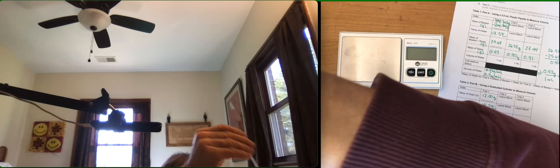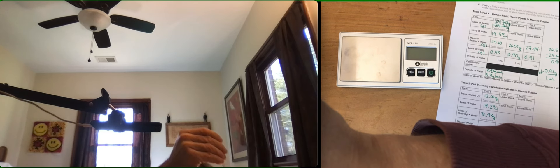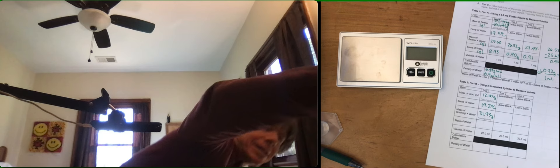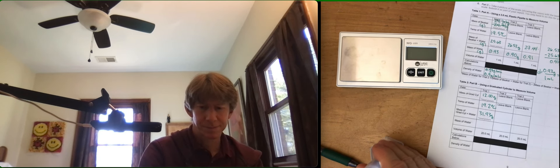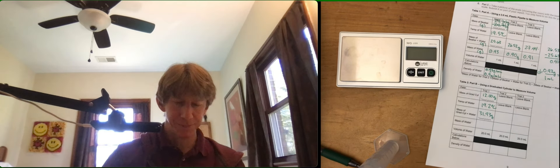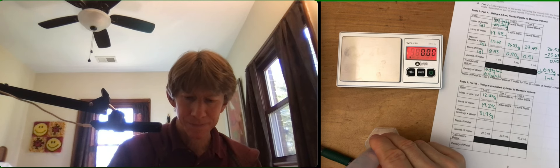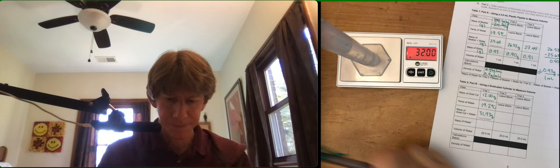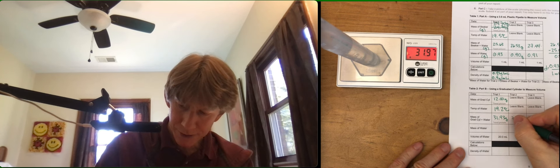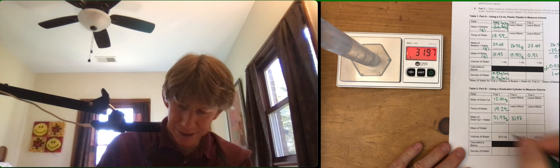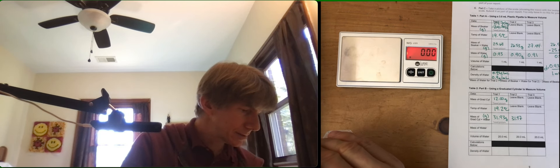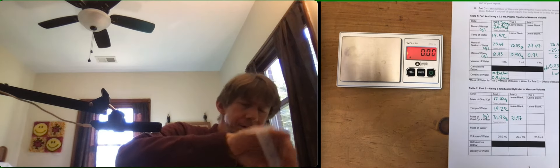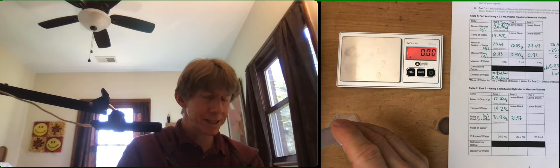Getting closer. Got my 20 now. Had one drop clinging to the side there, hopefully will put me perfectly at 20. Wait for the dot. 31.97, and these are grams. No need to take a picture of that one, and then do it again.